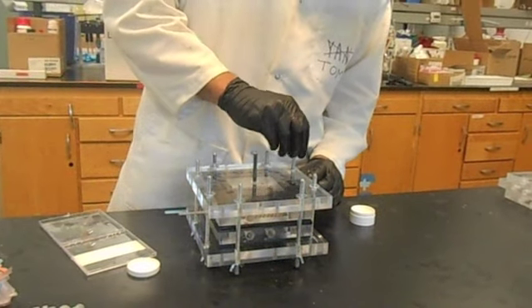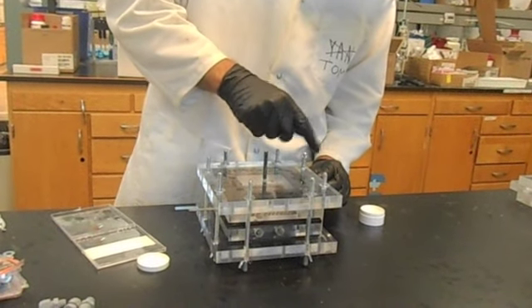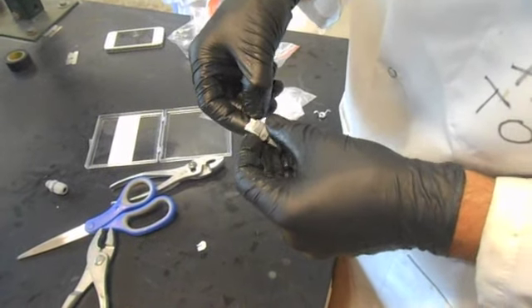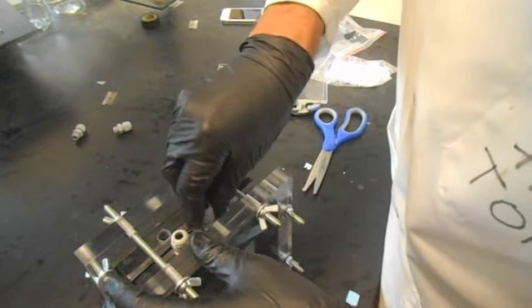Once the cell is on its side, you can proceed to firmly tighten the cell. Avoid over-tightening the cell and bending the frames because that will cause leaks. After tightening by hand, tighten at most 1/4 turn with the pliers. Finally, we Teflon tape all of our nylon glands and screw them into the tapped holes for the tubing, anode, and reference electrode.